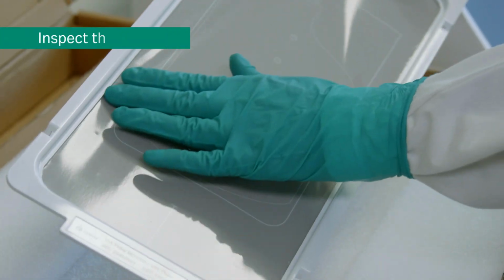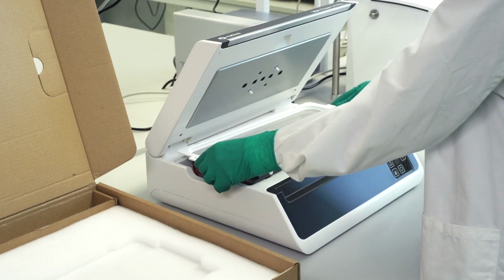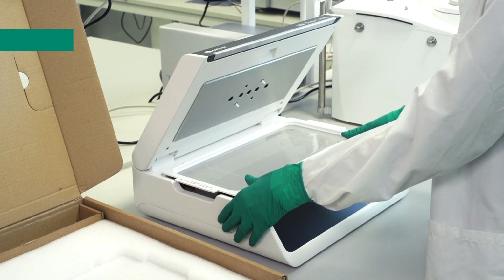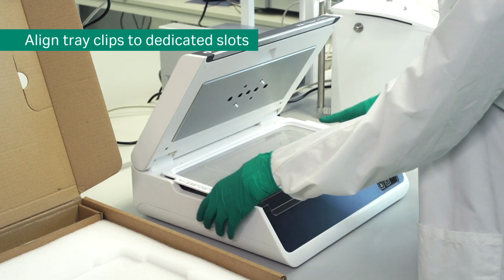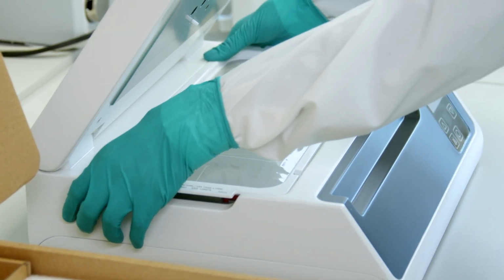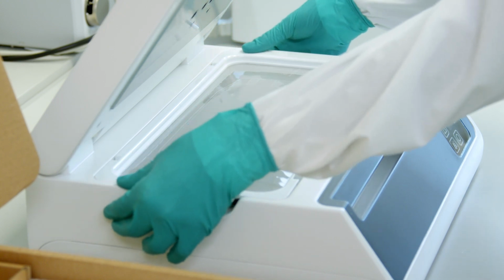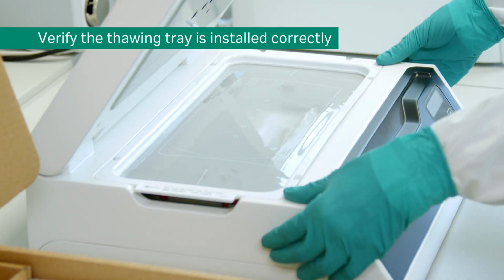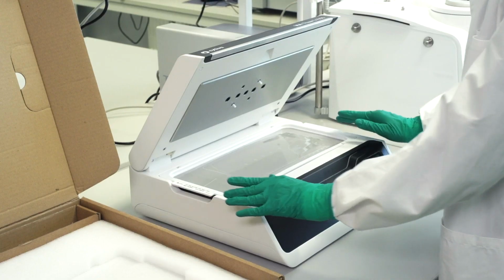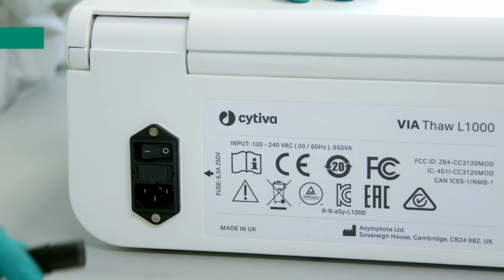Unpack and inspect the thawing tray for potential damage. Place the thawing tray on top of the bottom heating plate. Make sure the 4 tray clips are aligned in the dedicated slots on the instrument. Press firmly around the edge of the tray so that it clips to the instrument. Verify that the outer edge of the thawing tray is aligned with the edges of the cavity and that the gap between the instrument and tray is even.